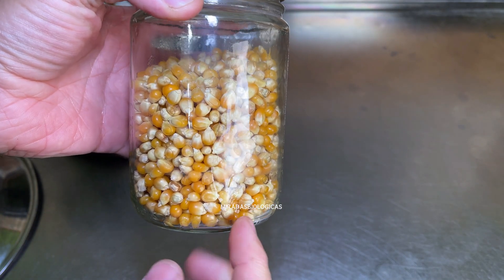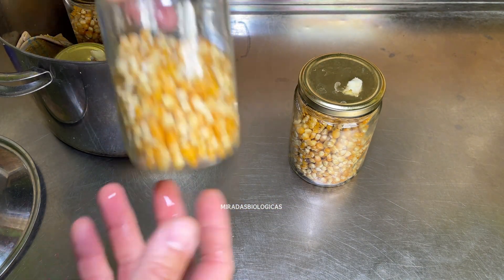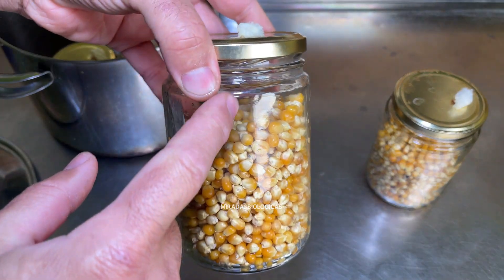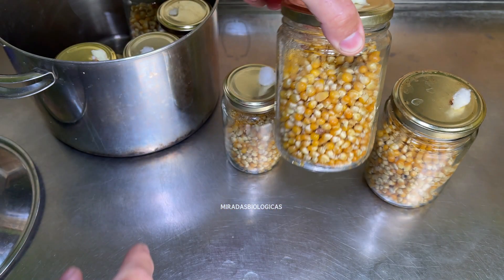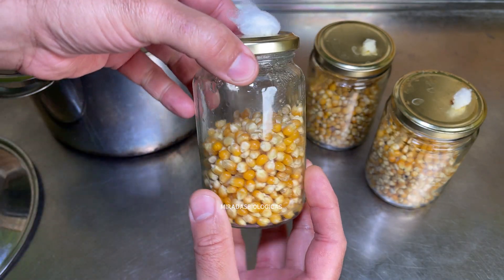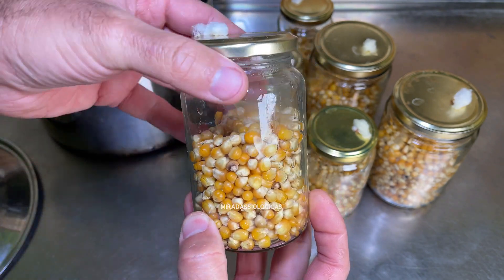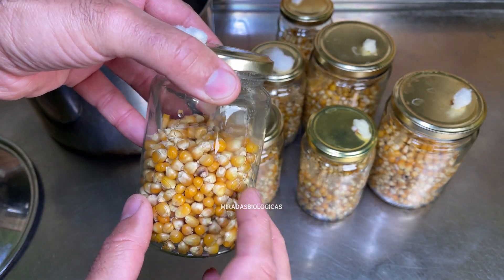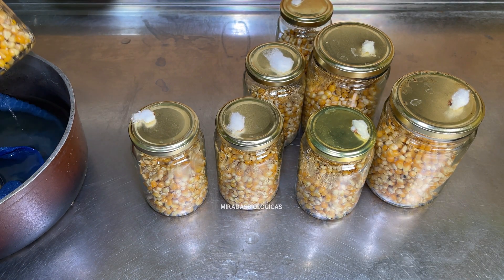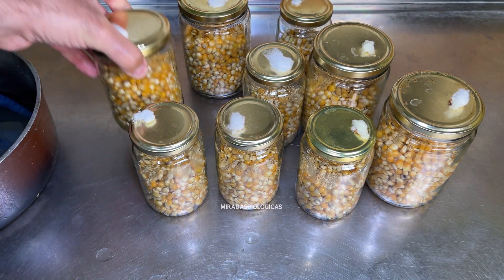Look how they turned out. It's important that we don't have water retained at the bottom — we don't want standing water. Rather, we should see loose kernels, because that will ensure that once we place the mycelium on top, it can invade all the corn kernels down to the very bottom. It's also important to have airspace in both the large and small jars for good air exchange so the mycelium grows much better. It's important to seed the mycelium when the corn kernels are at room temperature, not warm or hot, because that can affect the mycelium's viability.